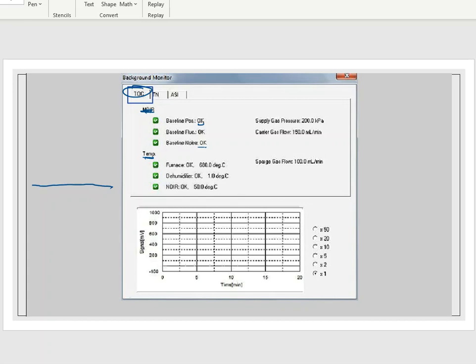All right. Also notice on the screen here, there's negatives. Here's a negative 100, and then there's a 200 to 400 to 600 to 800 and 1,000. Normally what we want to see is a baseline that is going to happen at the 0 mark. We want it close to 0, and we want it to stabilize near 0, give or take a little bit, okay? We do not want to see an elevated baseline. If we see an elevated baseline, let's say it does get stable, but it stabilizes right up here above 200 and it goes flat, we know that there's another problem. That other problem is probably a detector problem, an NDIR problem.